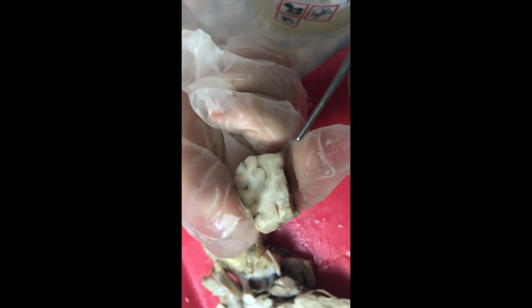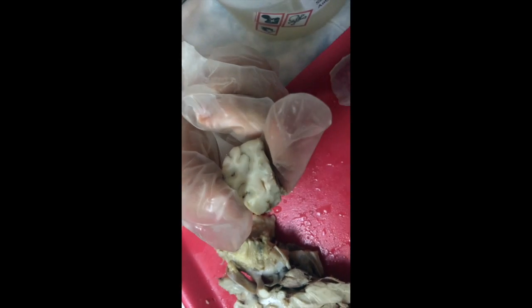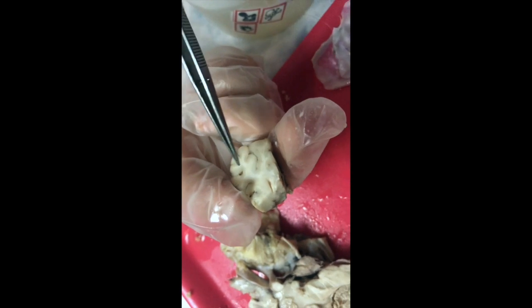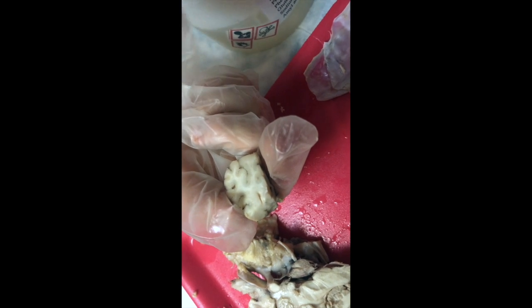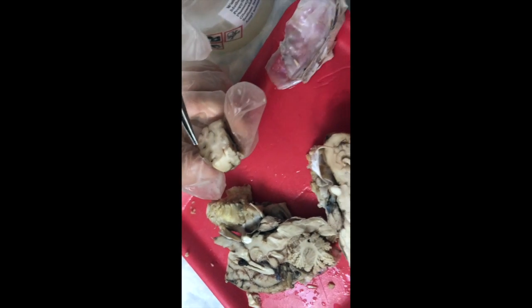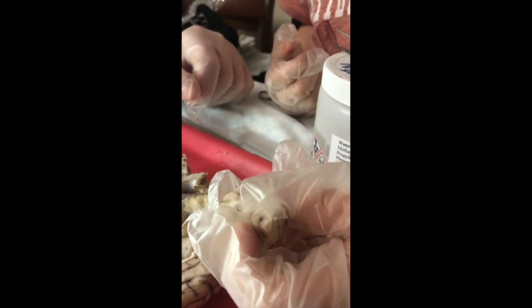So all of the cerebral control centers, precentral gyrus, prefrontal gyrus, all of your somatosensory cortices, your visual cortices, come in that little thin gray matter on the outside of the cerebrum. Okay. And there you have your brain dissection.